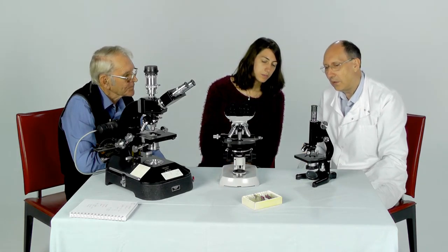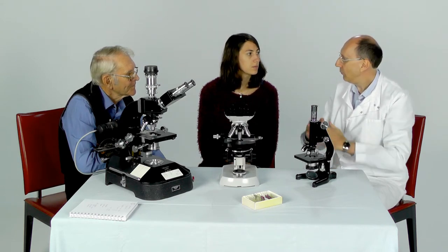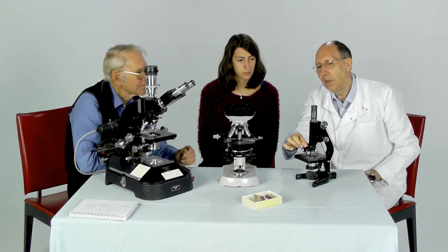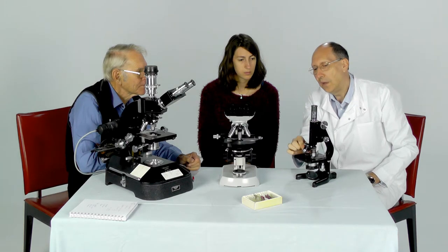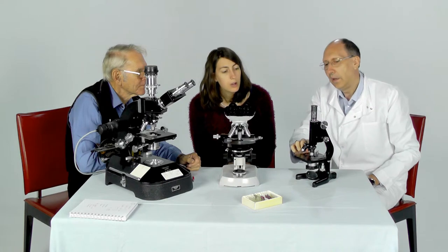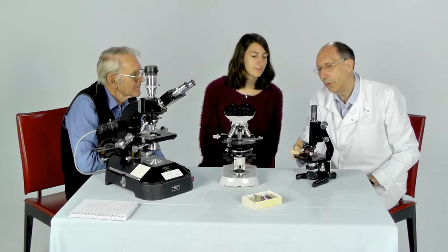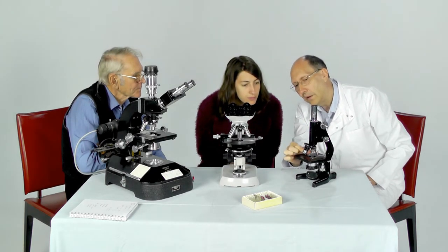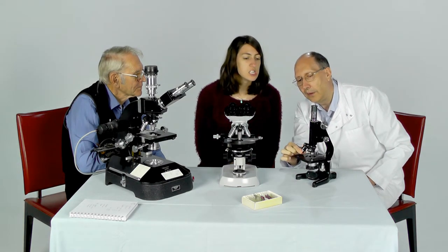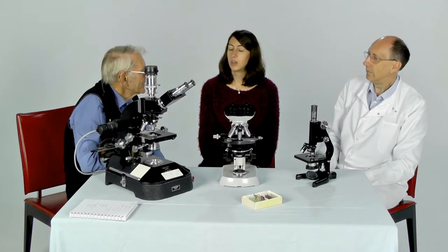This is often described in microscopy as numerical aperture — it's the measure of that cone of light. If you look at any of the objectives, they will have a number giving their magnification and also their numerical aperture. For example, the 3x objective shows NA 0.13, the 10x shows 0.28, and the 40x shows 0.70. The scale runs from about 0 to 1.3.